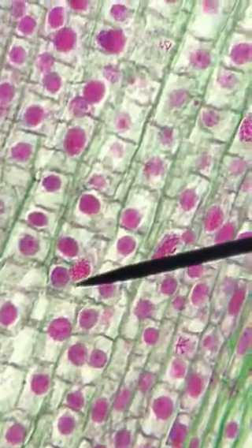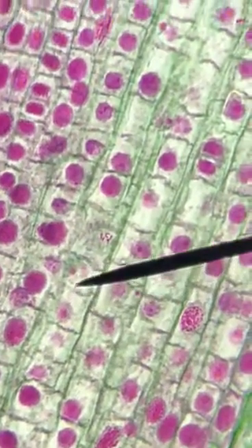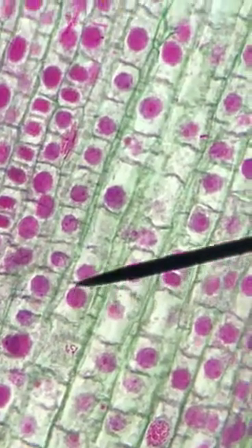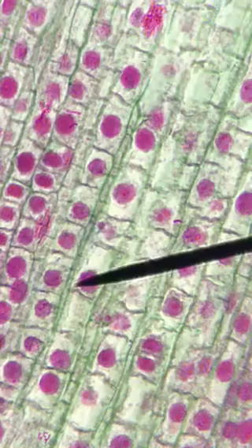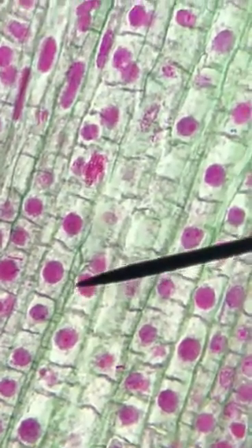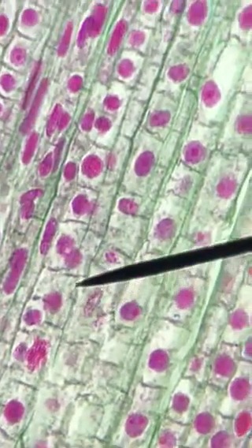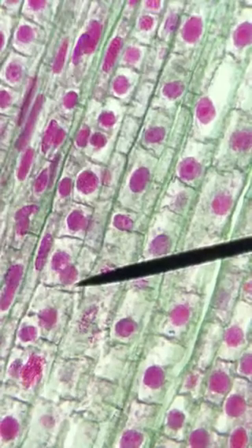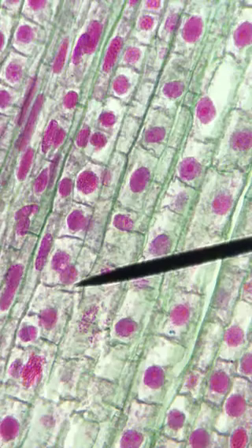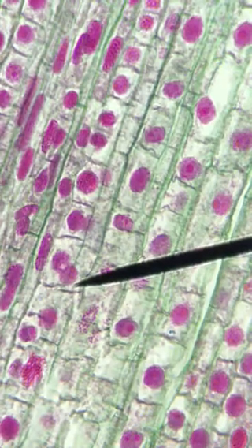Prophase, prophase, interphase, probably interphase. You don't even see much of the nucleus here. Interphase, prophase, prophase, interphase, prophase, and so forth. I'm going to move back over here. There's a prophase up there. So, you do the best you can. It's not perfect, but even if you jump around to adjacent rows, you're still probably going to come up with the same data in terms of percentage.